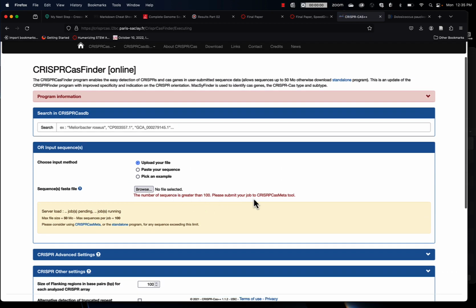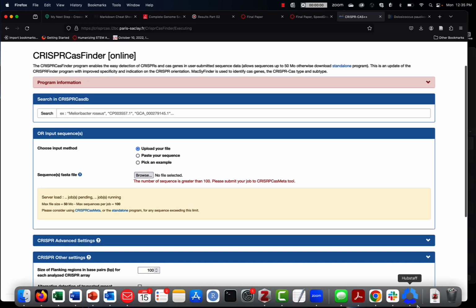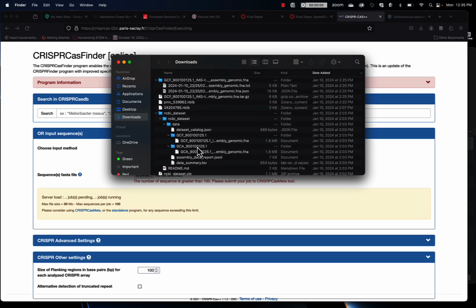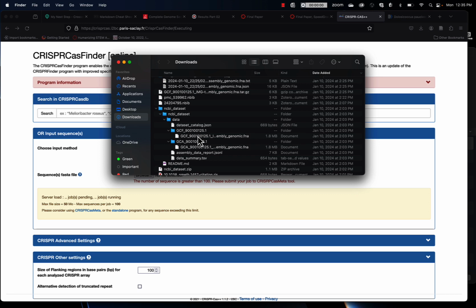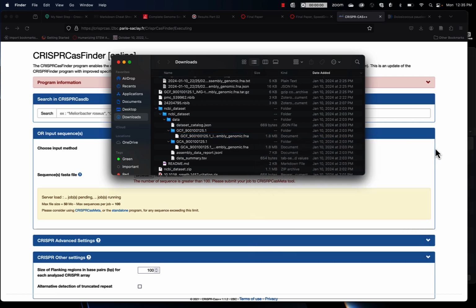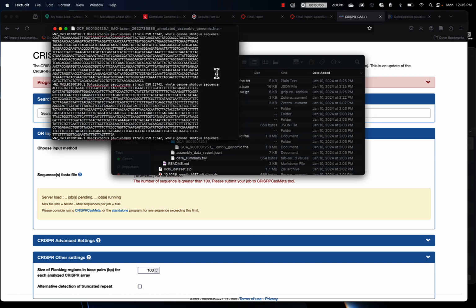I'm going to leave all the settings and run it. And you see that I now got this error. So what we have to do, and this is easiest for people who have a Mac, but it's totally fine if you have a PC or Windows. I know how to do it on a Mac. On a Mac, you'll want to open your genome sequence in what's called TextEdit. On a PC, you'll want to open it in Notepad. So I'll right click, open with TextEdit, because I'm on a Mac. If you don't have TextEdit, or you don't know exactly what that means, maybe somebody in your group does, or email me and I'll try to help you.